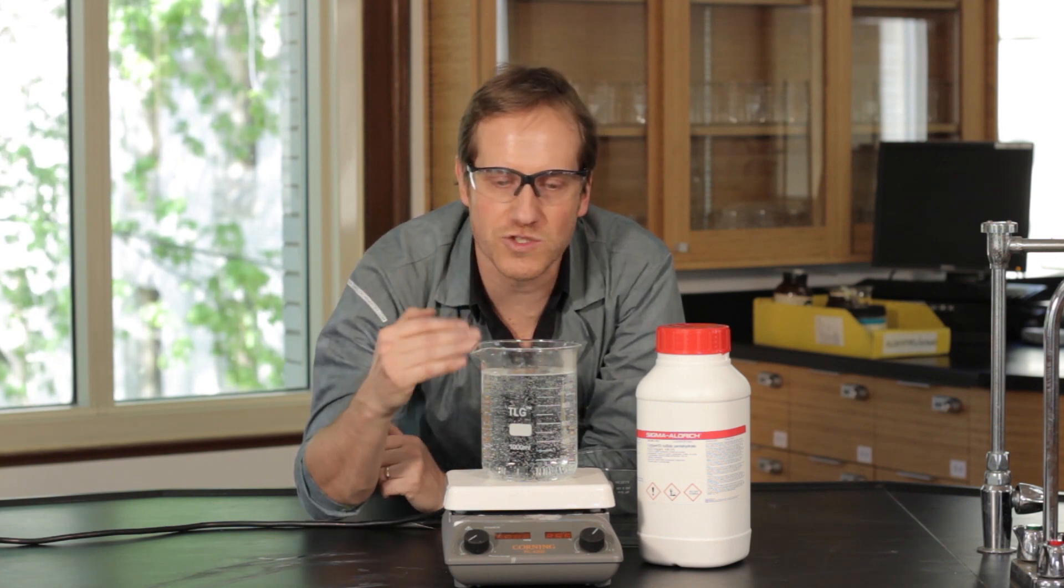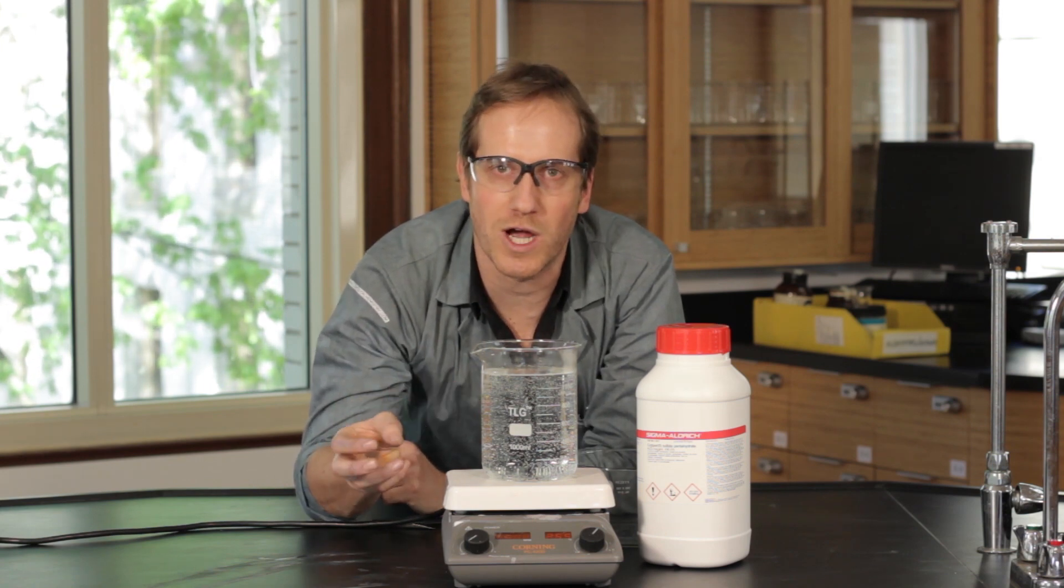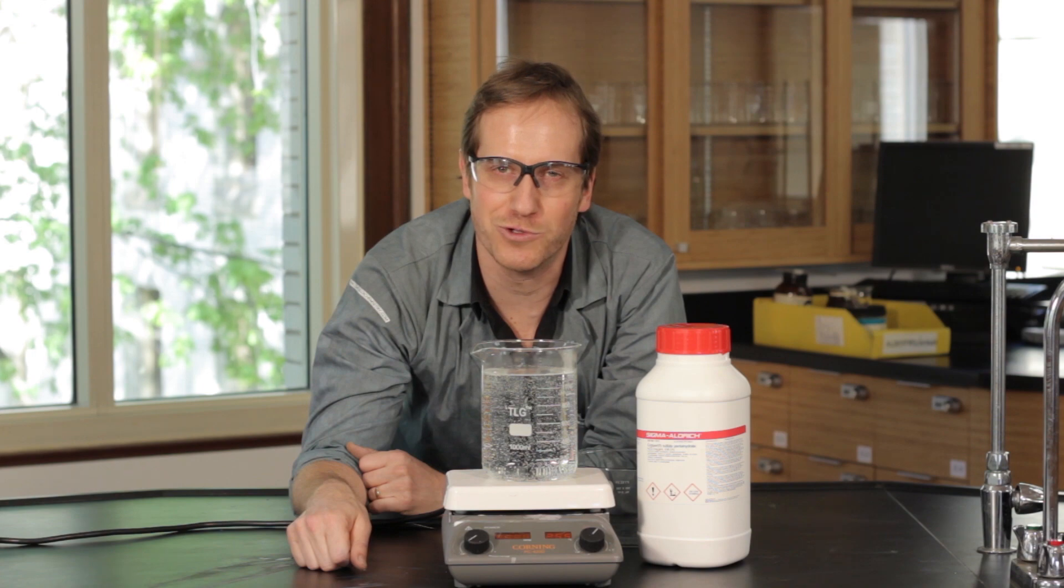On top of it, water is going to evaporate over the few days. So more crystals will come out and hopefully we'll be able to get some nice blue crystals.